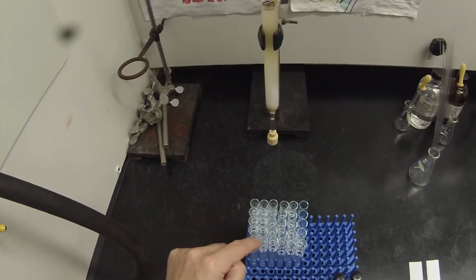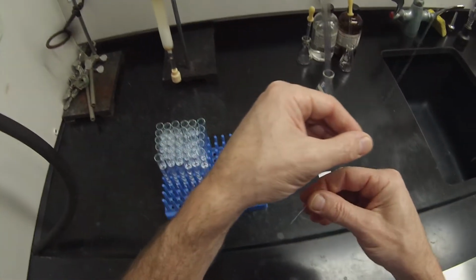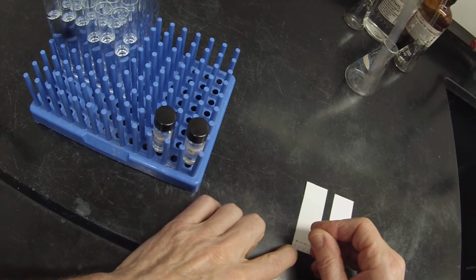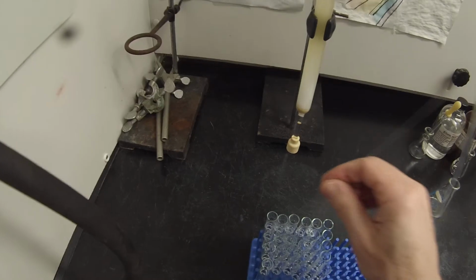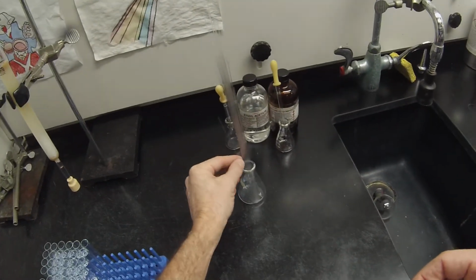Two, 3, 4, 5, 6, 7, 8, that's 9. Oops, broke it.